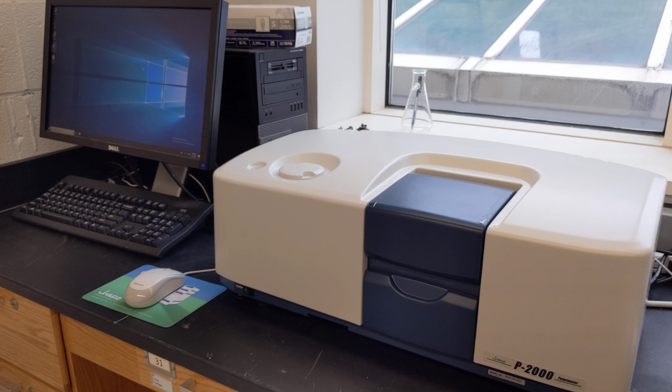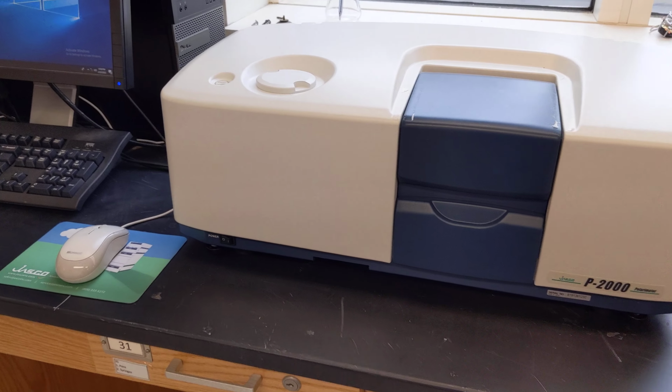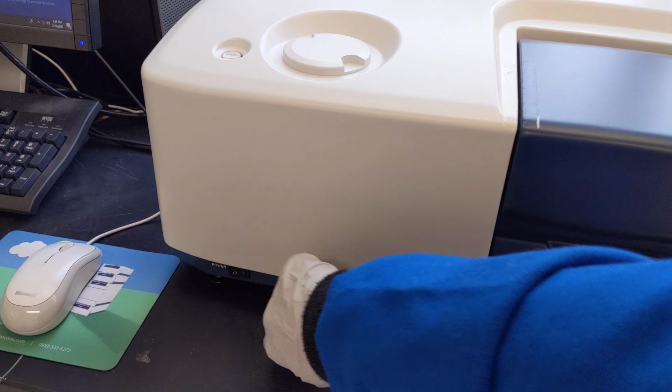This is a training video for Jasco P-2000 polarimeter. So far I just have the computer turned on. I need to turn the instrument on. Green light should come on.